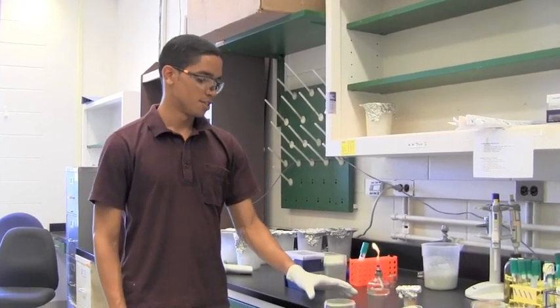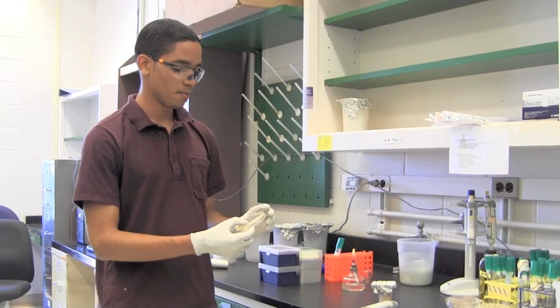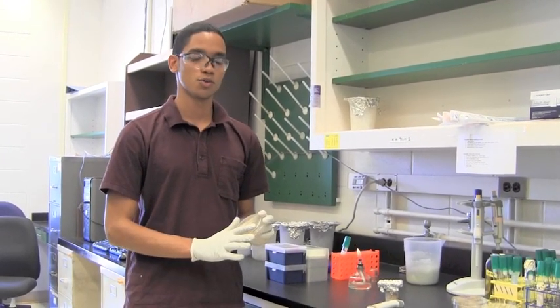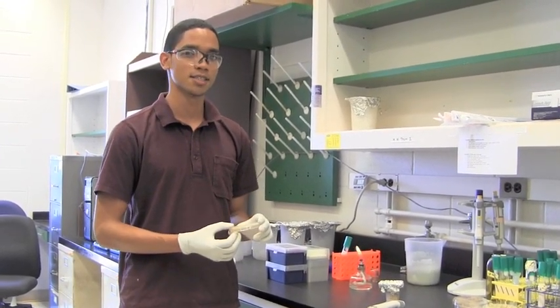Hello, my name is Simon and I'll be demonstrating how to make a spread plate. A spread plate is a method of making a uniform layer of cells that can be used for a variety of assays and tests.